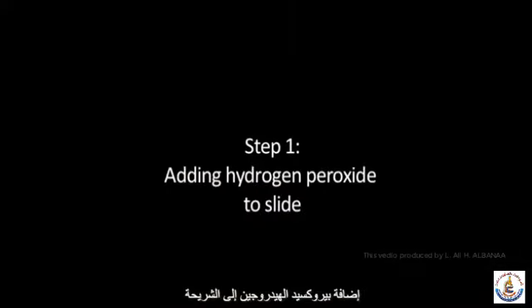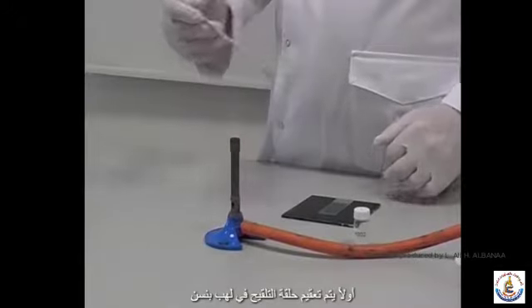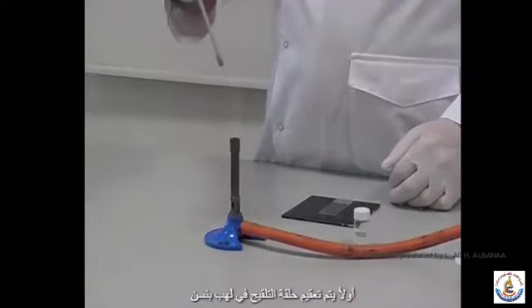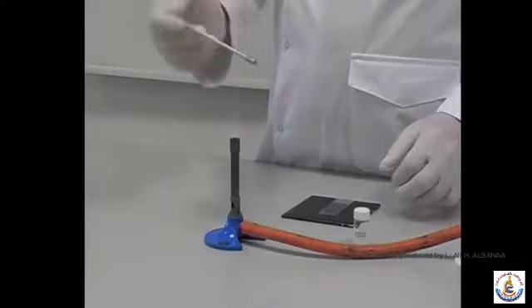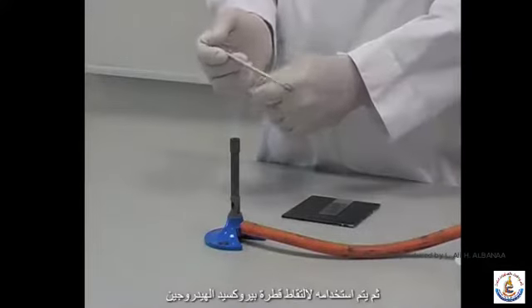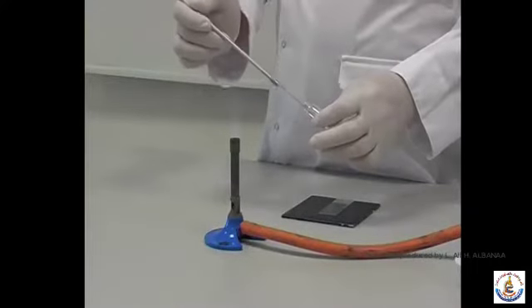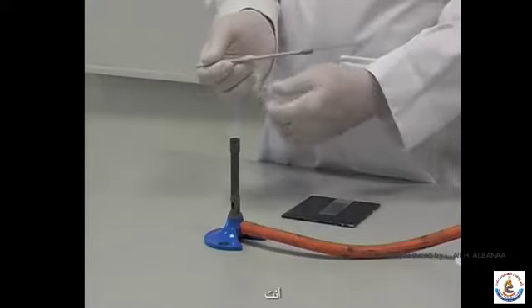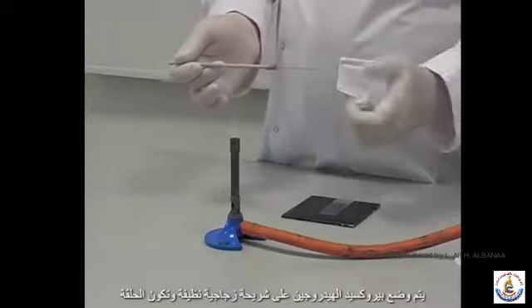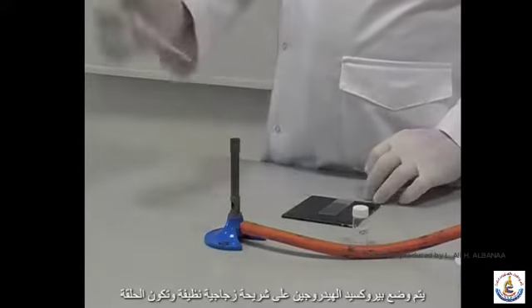Step 1. Adding hydrogen peroxide to the slide. Firstly, an inoculating loop is sterilised in the Bunsen flame. It is then used to pick up a drop of hydrogen peroxide. The hydrogen peroxide is placed onto a clean glass slide, and the loop is sterilised again.